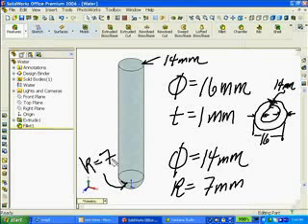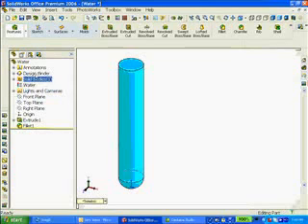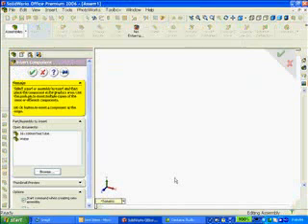But for cosmetics, so that we can clearly see the water to be inside the test tube, let's click on the water, go to the Edit Colors tab, and change it to a darker blue. I have my water modeled, and I also have my test tube. So now I'm going to create a new assembly. Click File, New, and select Assembly. And then I click OK.